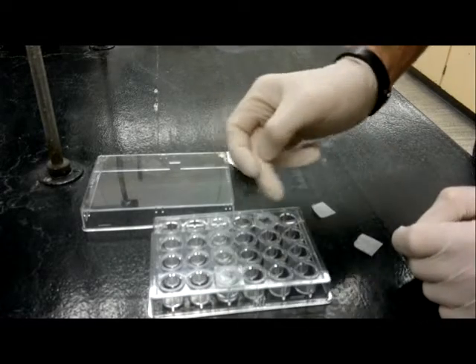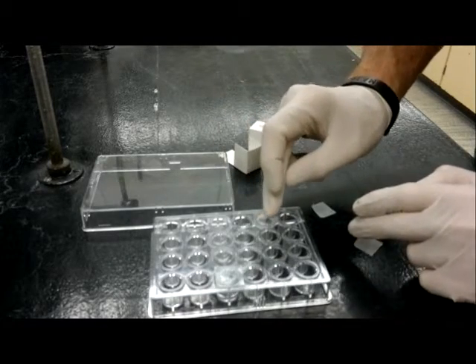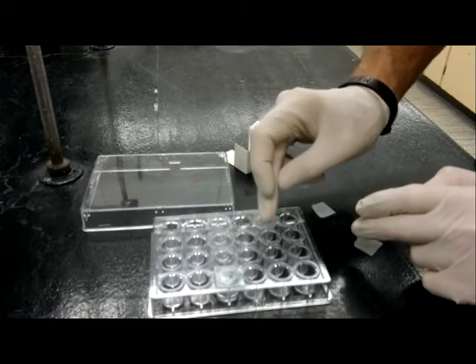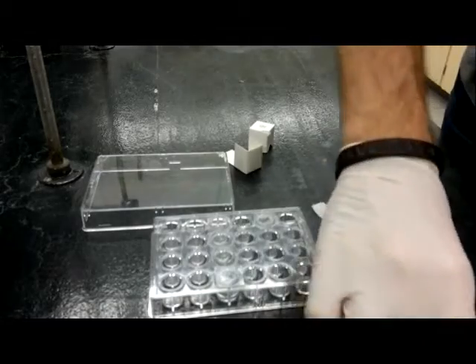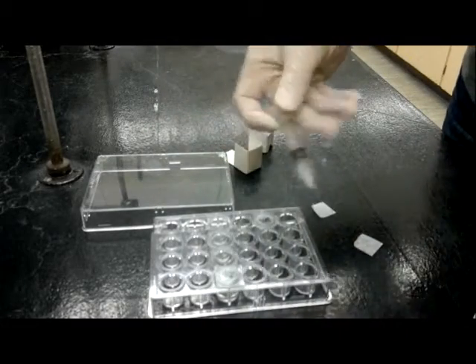Simply drop it on top of the appropriate well, apply a little pressure and you can see through the cover slip whether it's sealed all the way around. And then leave that undisturbed for at least 24 hours waiting for crystal development.